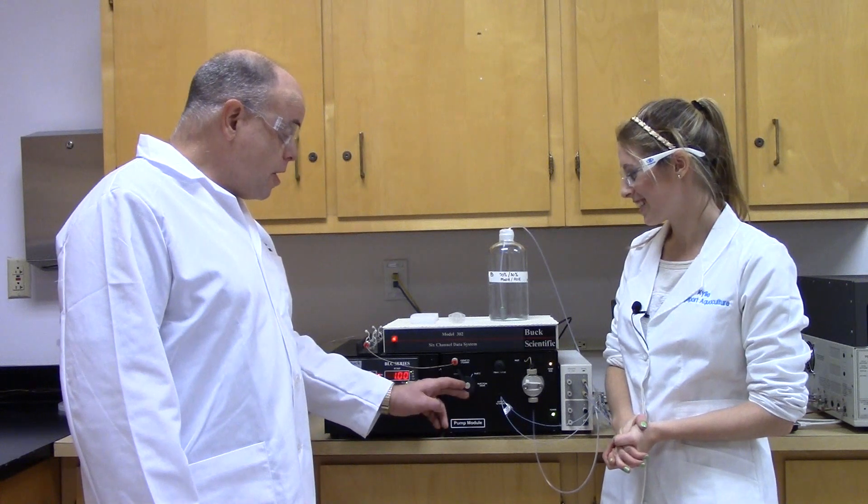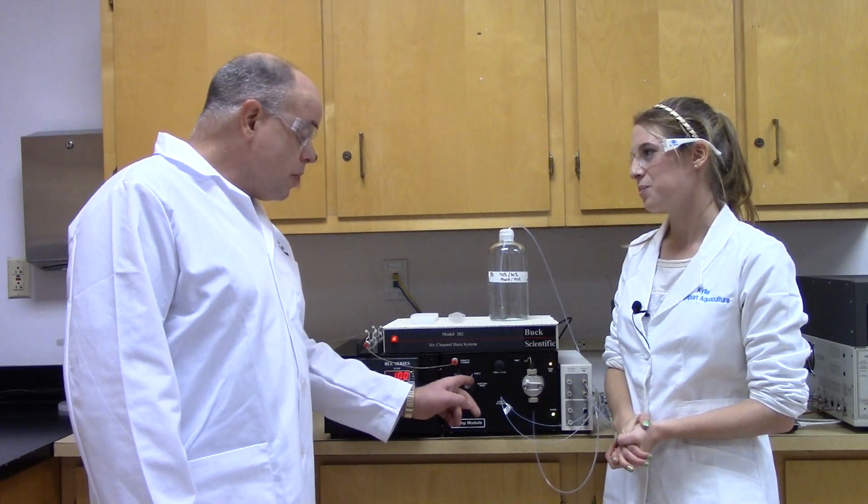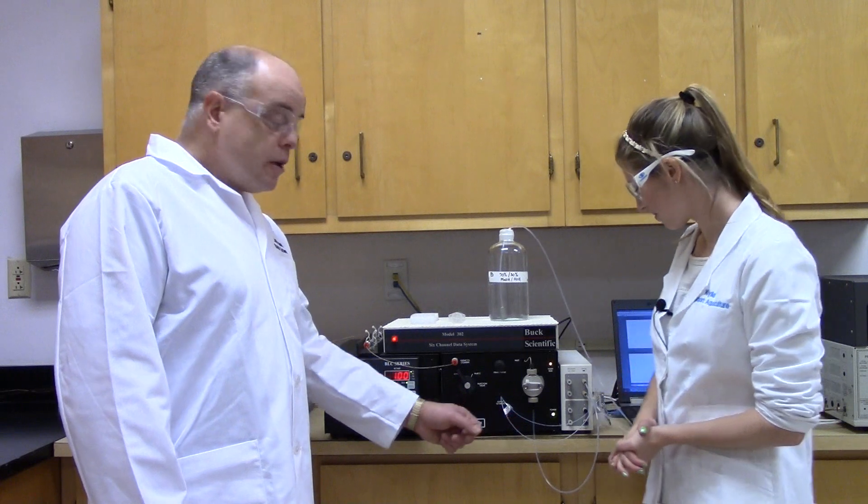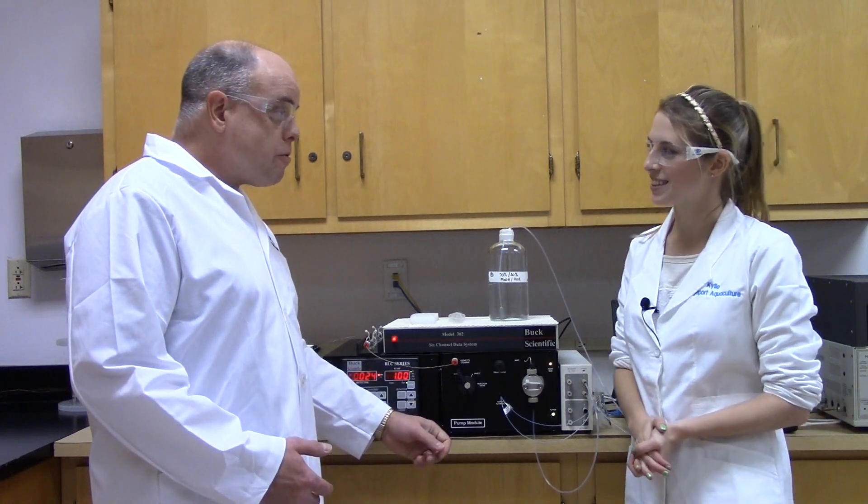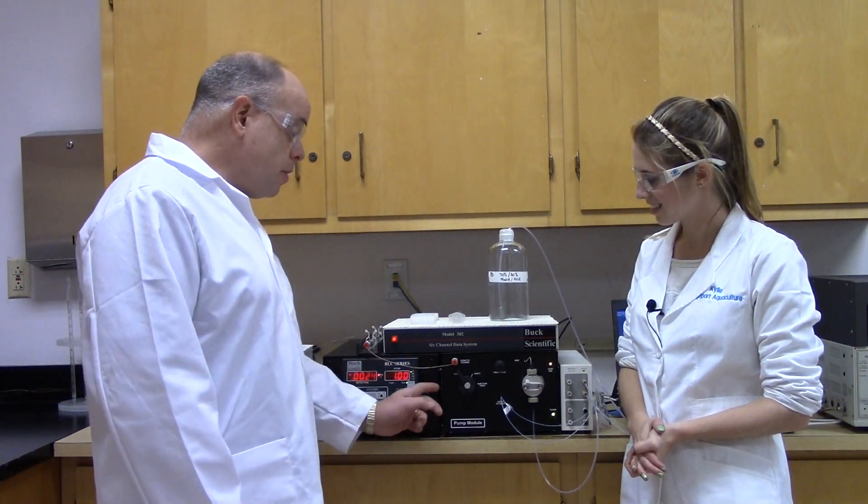Actually, nothing. What happens is the contents of the syringe simply go through the waste tubing of the valve. So, to correct the mistake, move the injector back to the load position, refill your syringe, put in your sample, and then inject it.